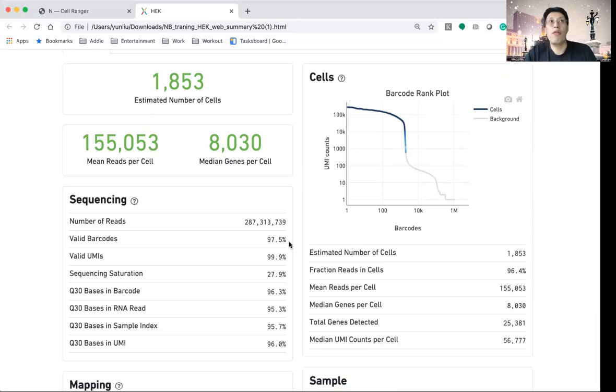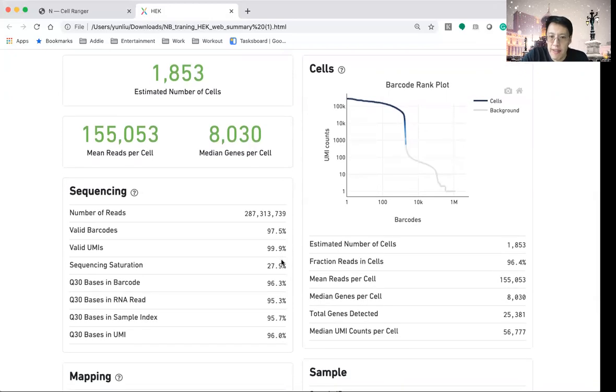So for the sequence reads that share the same barcode, they are considered coming from the same bubble in the previous lecture, but essentially the same cell. And over 99.9% have a valid UMI, or unique molecular index. Another piece of information I often look at is the sequence saturation rate.